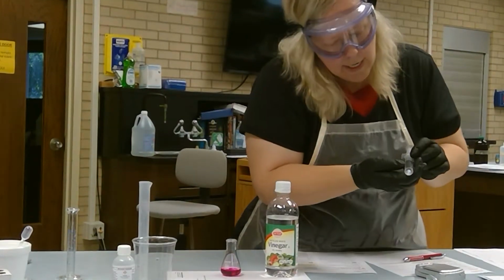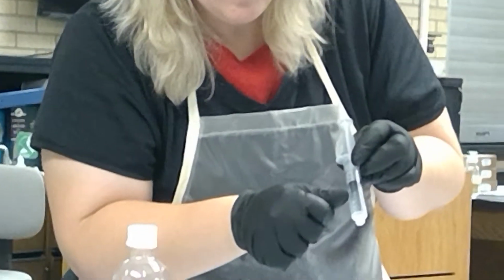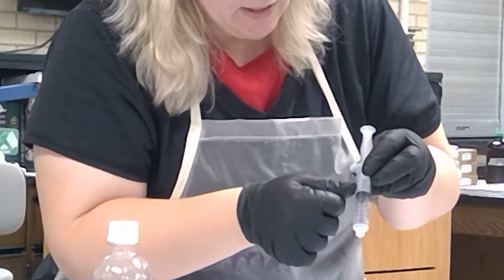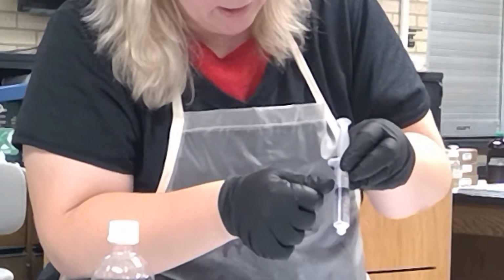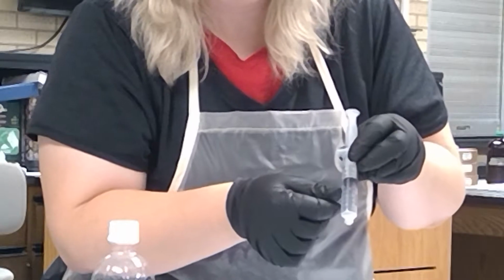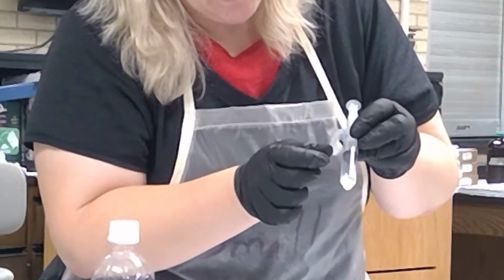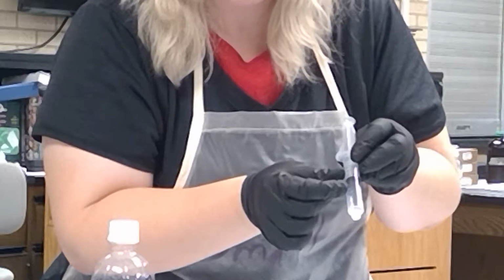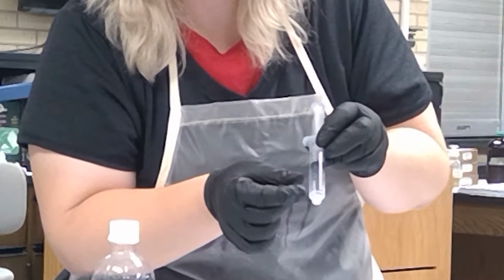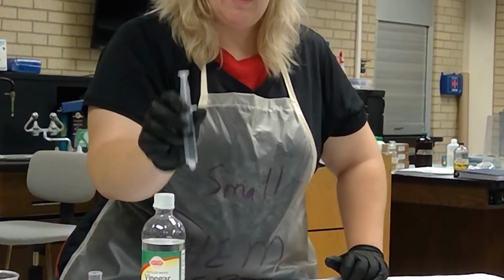Okay. So I ended up somewhere down in this area, and so let's say mine ended at 5. So the initial volume for mine was, before I started dispensing any sodium hydroxide, the initial volume read 9 milliliters. Then it ended at 5 milliliters. So the difference between those two would tell you exactly how many milliliters of base you have added. So if I started at 9, it ended at 5, that means I've added 4 milliliters of base, and that there would be another 5 milliliters of base remaining in the syringe.